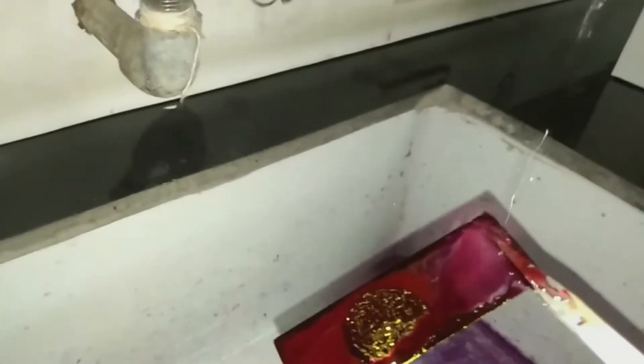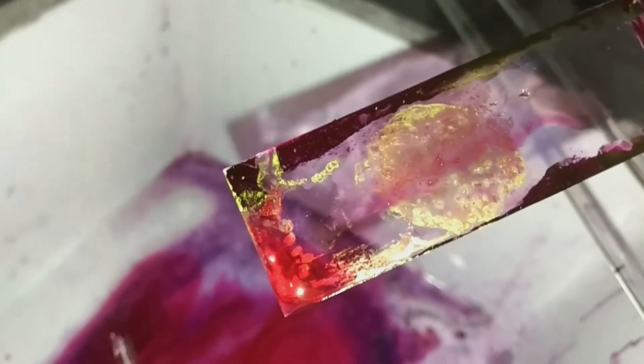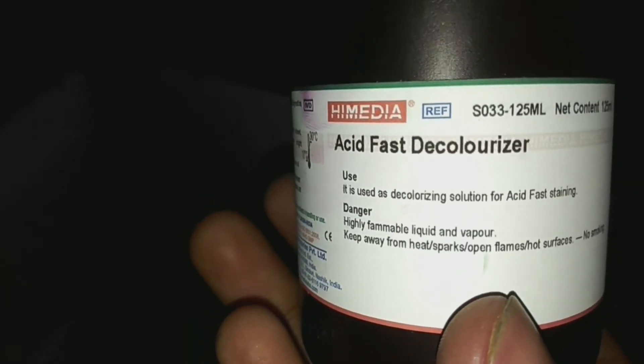So the total process is about ten minutes: five minutes of intermittent heating and five minutes idle, during which the carbol fuchsin stains the smear. After that, wash the slide with water. After washing, the slide appears not properly cleaned, so now decolorize it by flooding with the acid fast decolorizer.